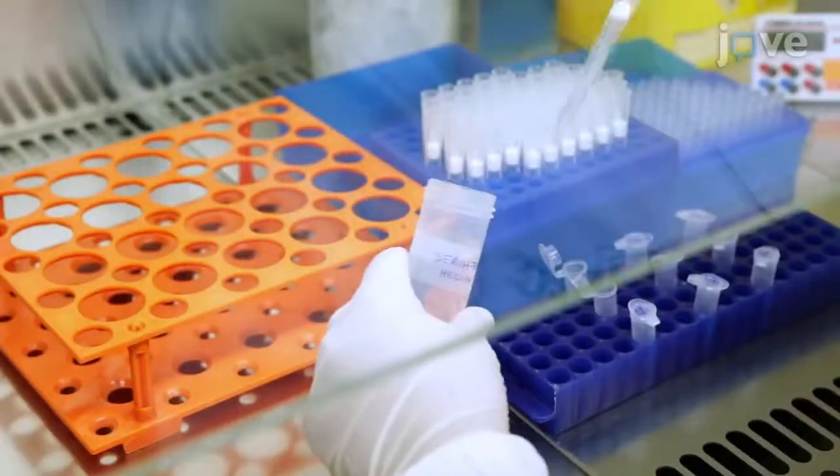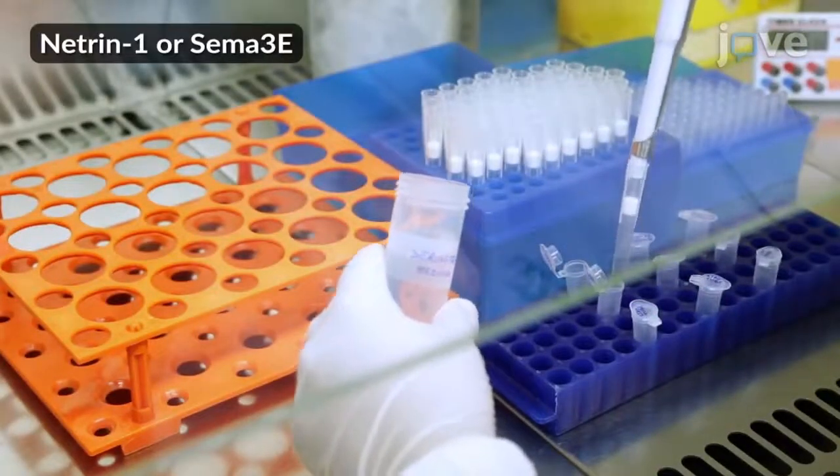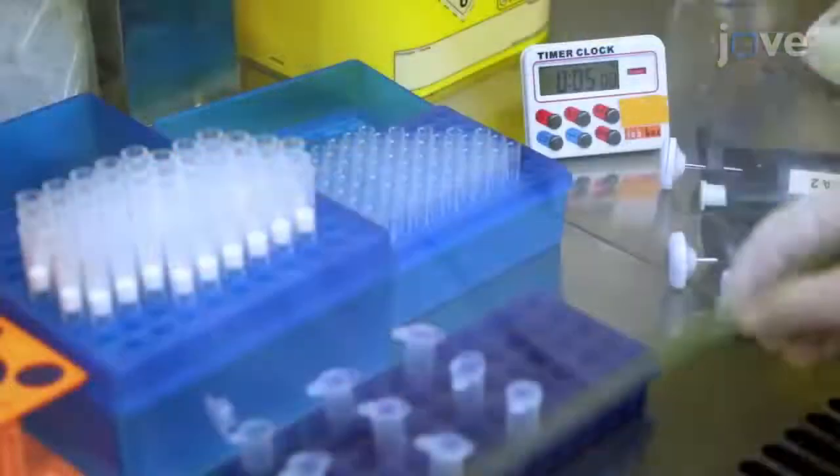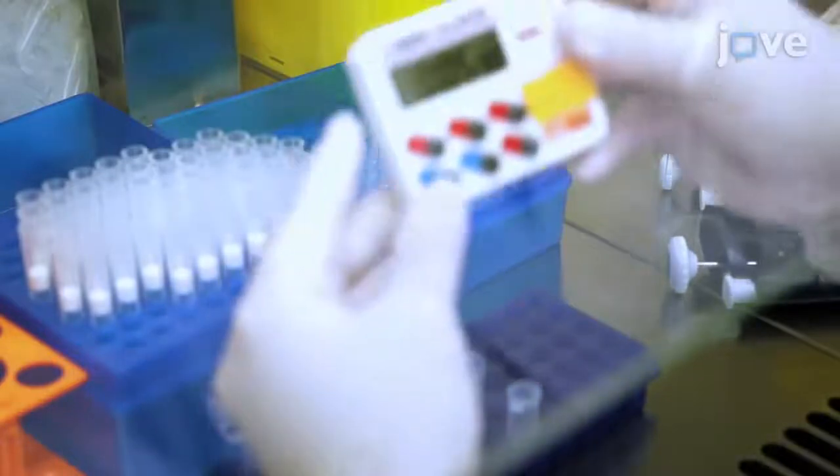First mix 250 µL of serum-free medium and 1-2 µg DNA in a 1.5 mL centrifuge tube and incubate at room temperature for 5 minutes.